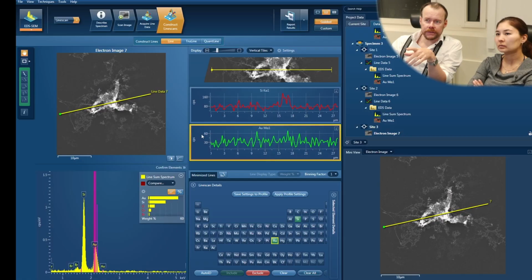But then it just starts over and scans and scans and scans. So that's why we usually scan until we click stop. So we just wait for the statistics to come up. If we see the statistics here, we can change the scale, I think, here. Can't we do that? I mean, we don't want to reset. I would like to.